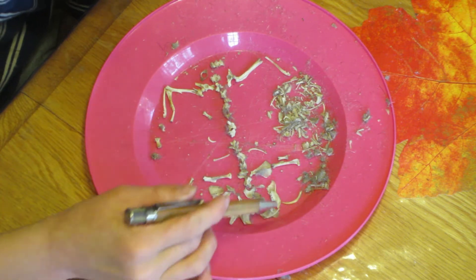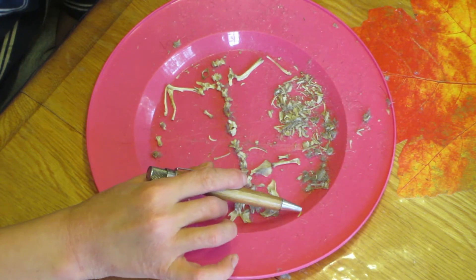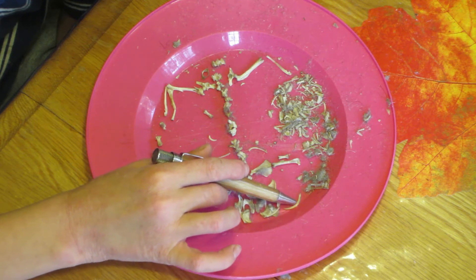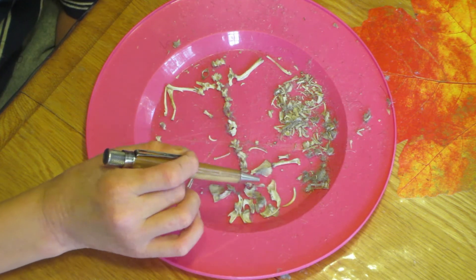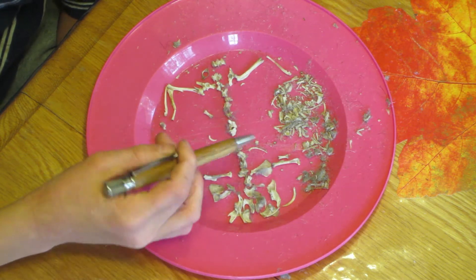We have this one that's sort of out of place. It's got a cutting edge on it, so there's a possibility that it could actually be an owl or a hawk claw — something like a talon. But I guess that's all.